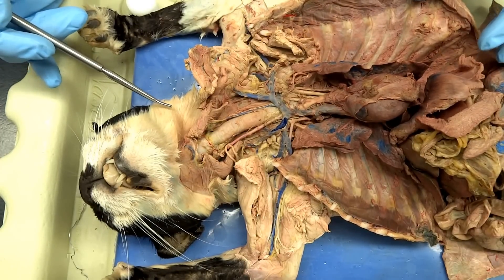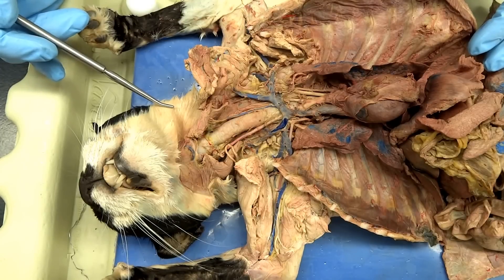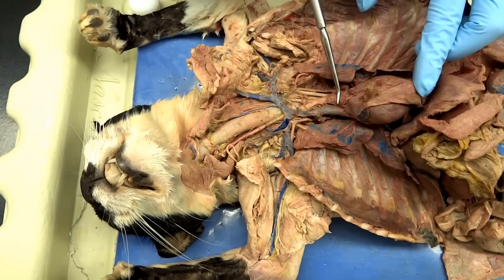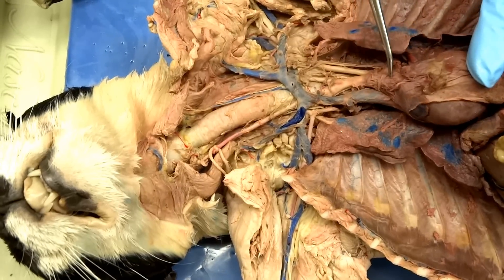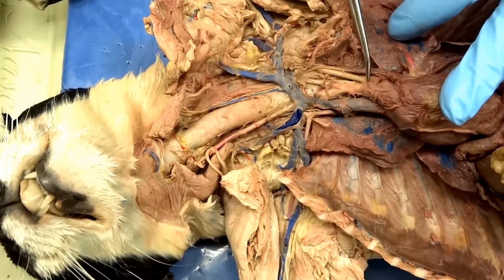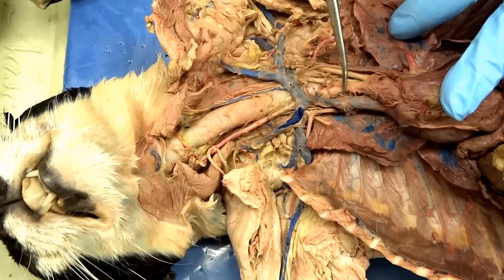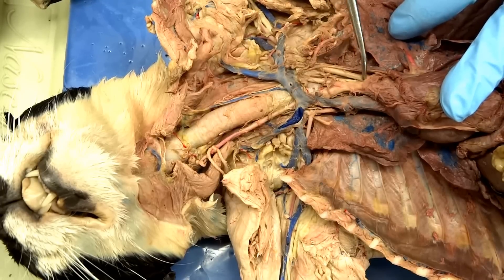Alright, so we are going to look at the upper arteries and veins and we're going to start with the arteries. This is going to be a little bit hard. So we're going to start from the heart and we are going to look at the aortic arch. You can see the aorta is kind of still buried in that pericardial sac, but there are two branches on the heart from the cat: the brachiocephalic artery and then the left subclavian artery.